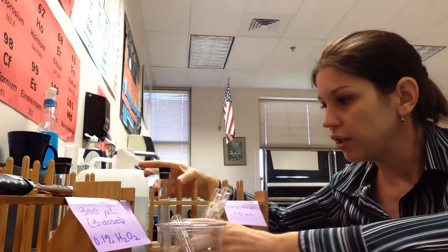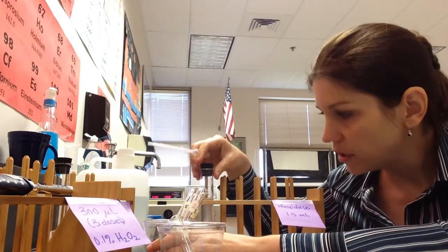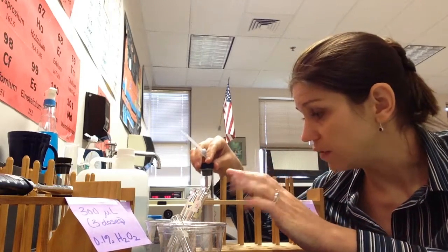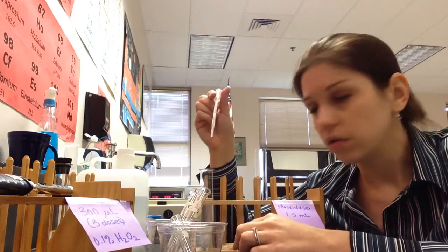And so when you're not using the stuff in the test tube, leave it capped, mostly because it really stinks. All of it really stinks, and so you want to just keep it capped so that the room doesn't smell awful. It's going to smell awful anyway, but let's try to keep it down.